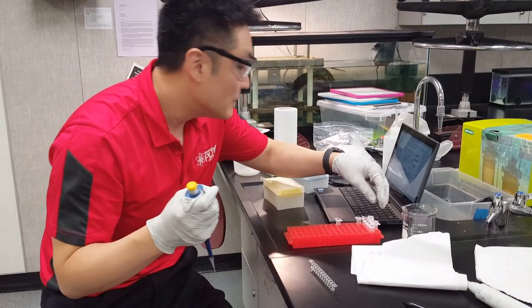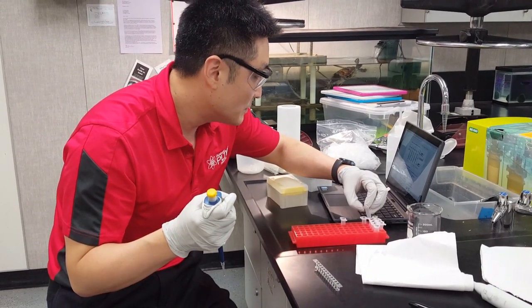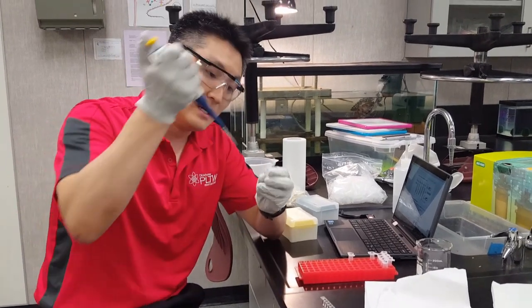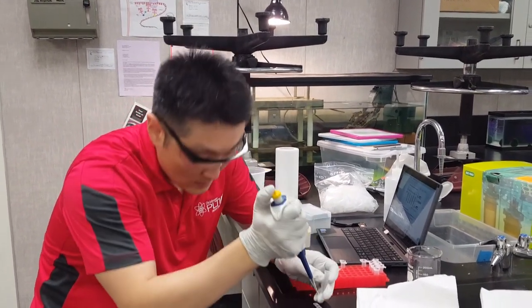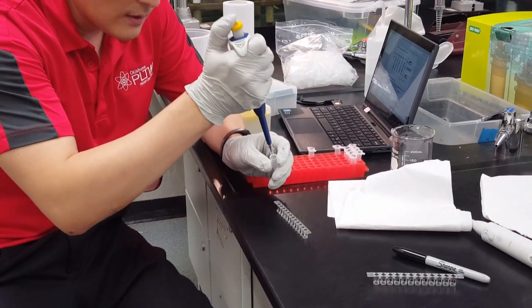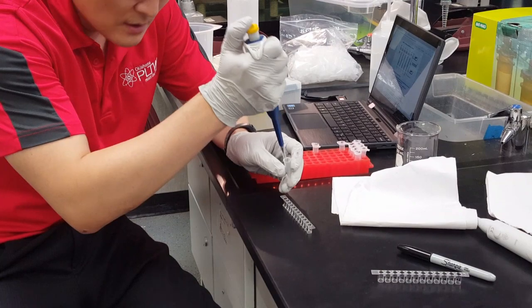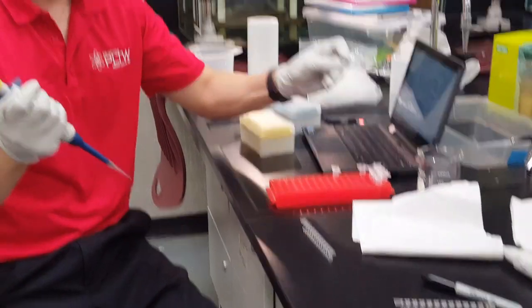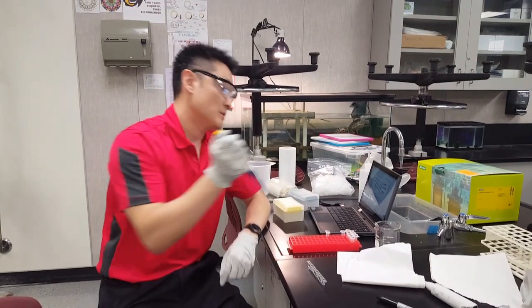Now get the negative control and add 50 microliters of negative control into wells 16, 17, and 18. Then change the tip again.